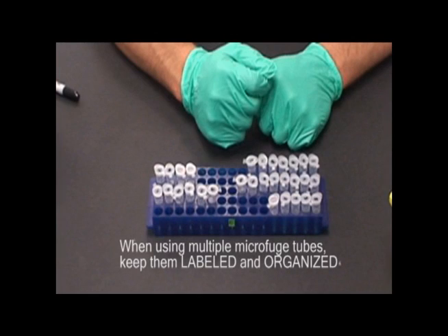At 100 minutes, serial dilutions are completed for all 3 flasks, as specified in the lab procedure.